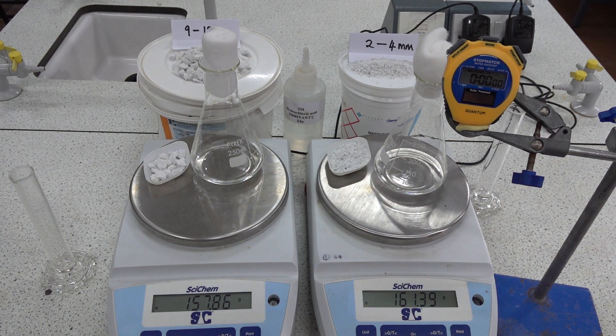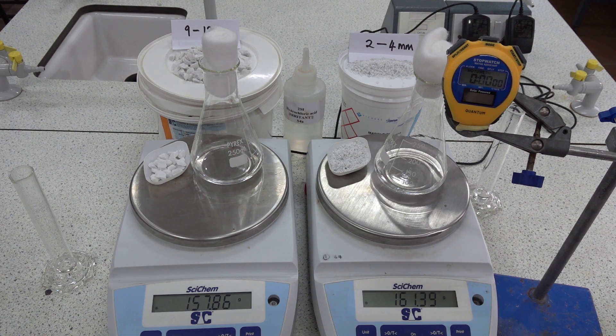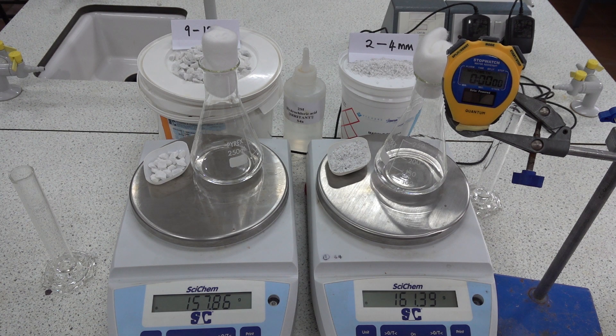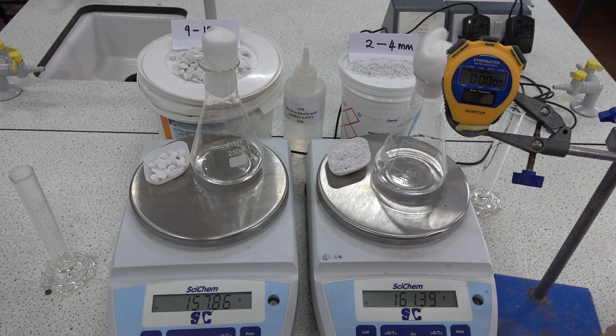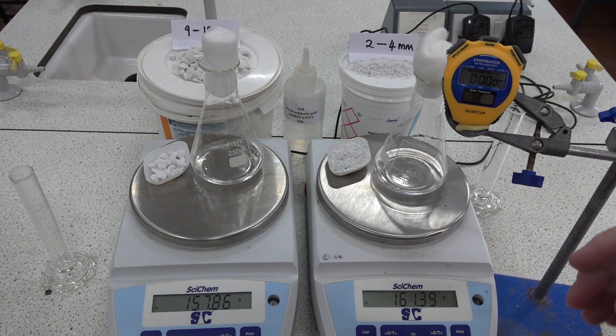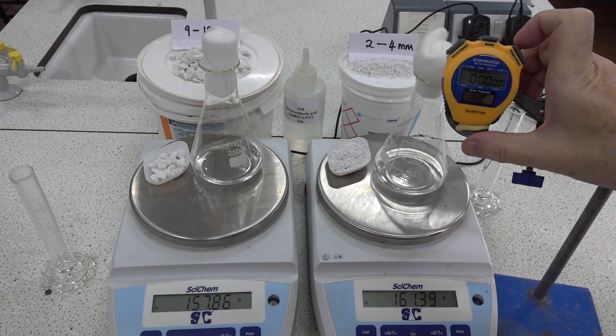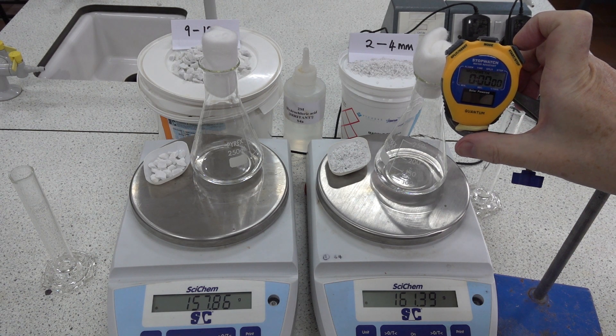The clock hasn't started yet. So what you'll need to do is to take mass readings with time as the reactions proceed.